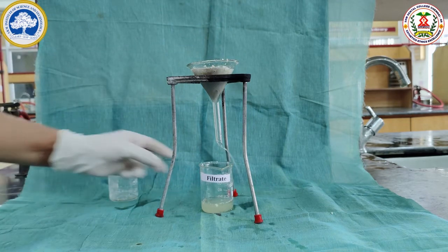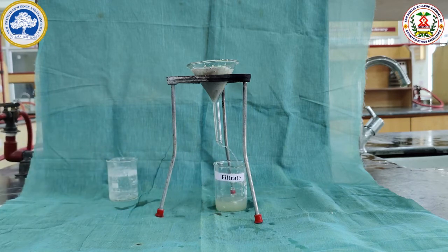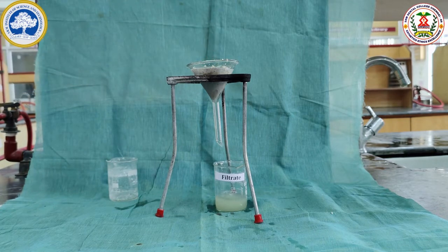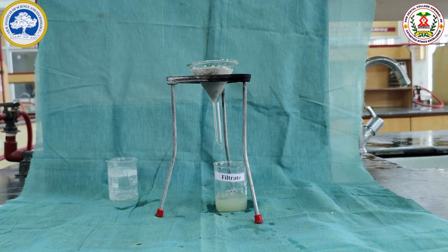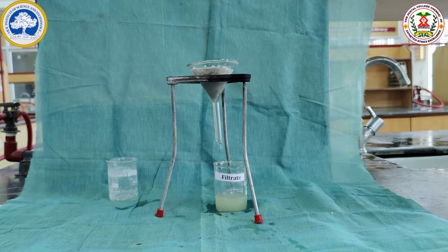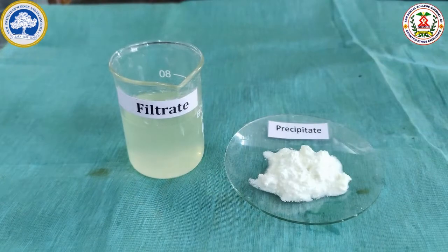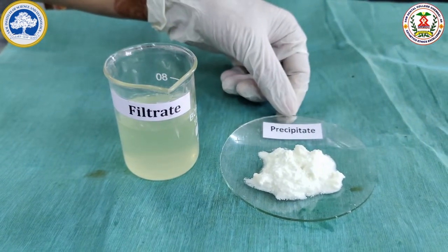Here we can see the separation of the filtrate. And what is remaining in the funnel is the precipitate. Here we are going to do the tests in the filtrate and the precipitate. Here we can see the separated samples of filtrate and precipitate.